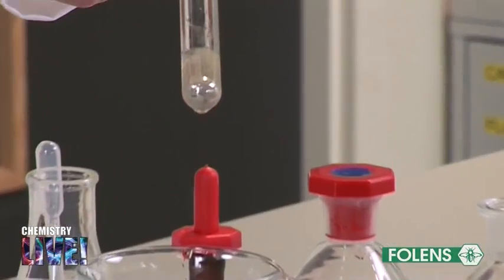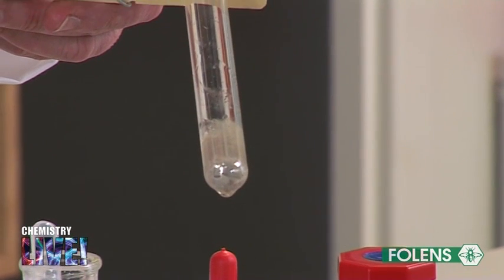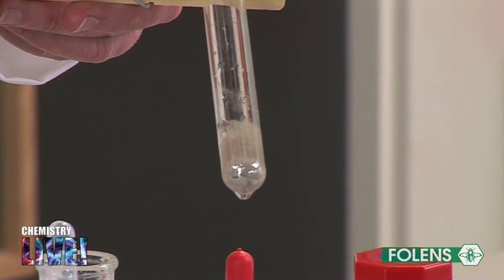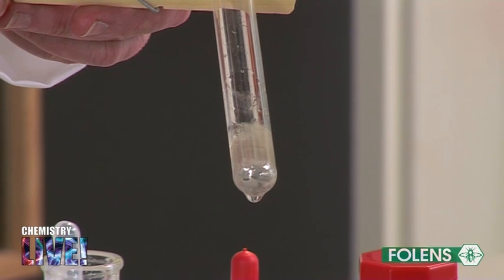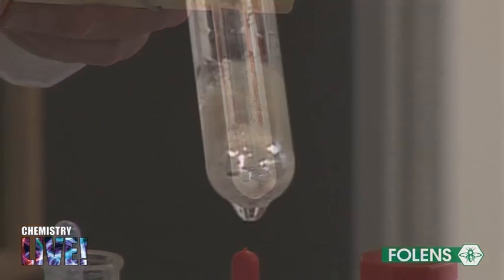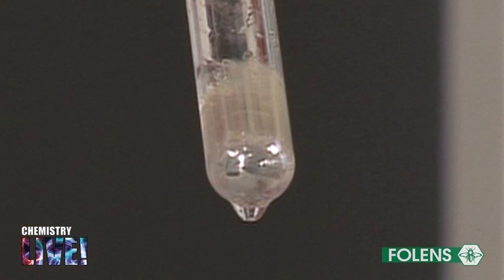Note the formation of a silver mirror on the inside of the test tube. No silver mirror is formed in the case of propanone. Using your textbook, explain why this is the case.